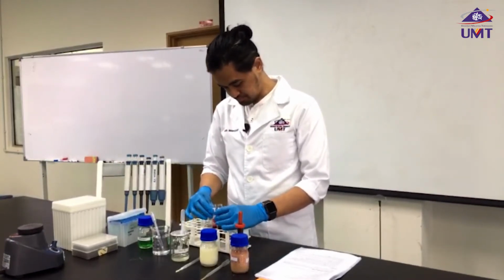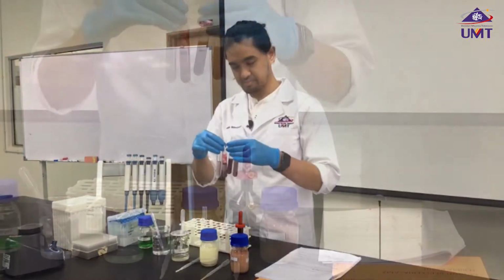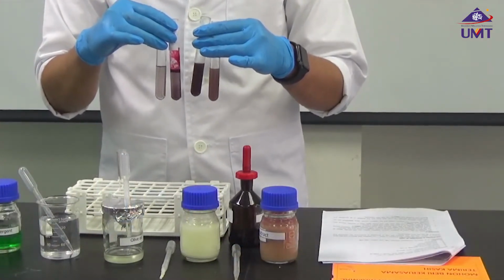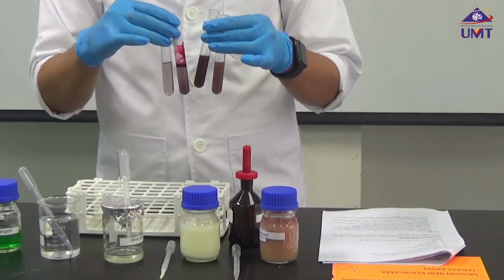Based on this tube, based on my experiment, what do you find? So please record it in your report.